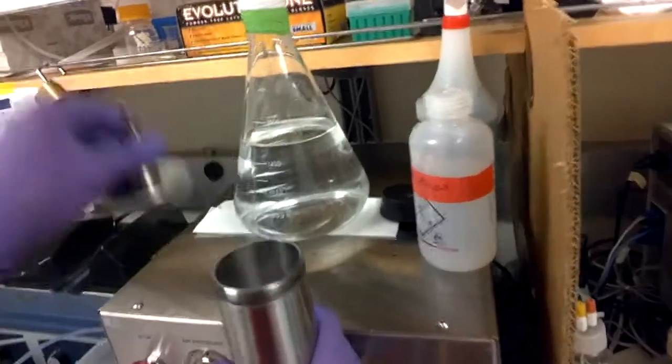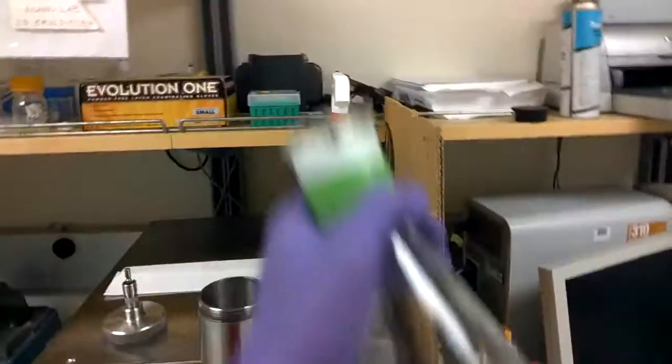And so that was just a little bit. Just two washes, and now wash number three.